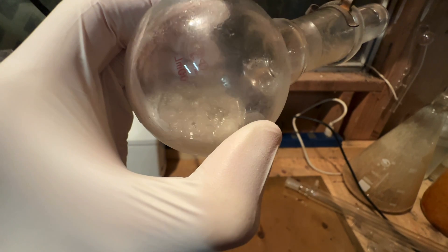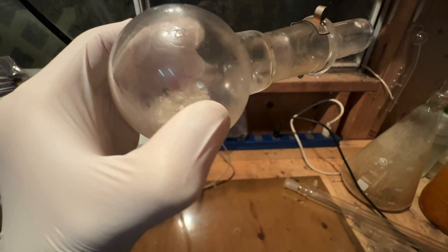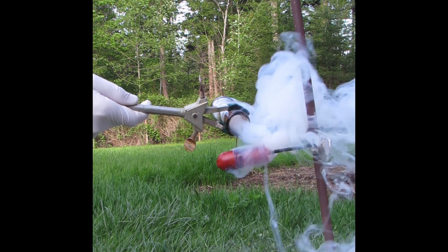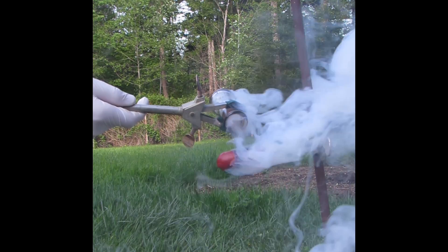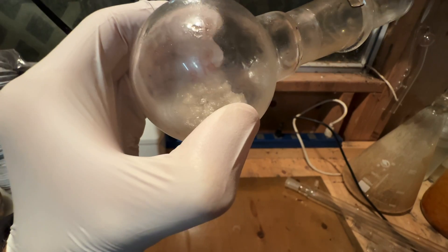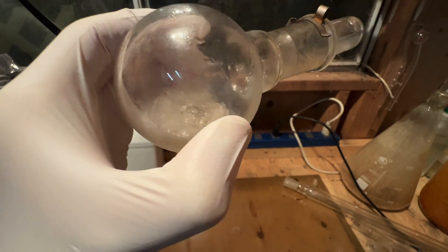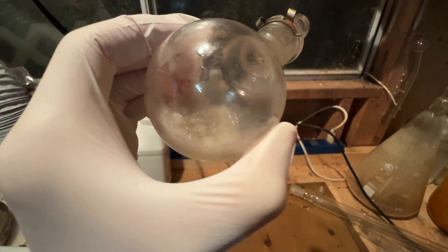Hey guys, and welcome back to another video. Today we will be producing some sulfur trioxide. As a side note, do not attempt this at home. Sulfur trioxide is a highly corrosive, fuming compound which forms sulfuric acid vapor on exposure to moisture in the air, and improper handling could result in blindness, lung damage, or severe burns. Despite this, it is necessary in the synthesis of thionyl chloride, which I need for some future reactions, so the preparation is necessary.